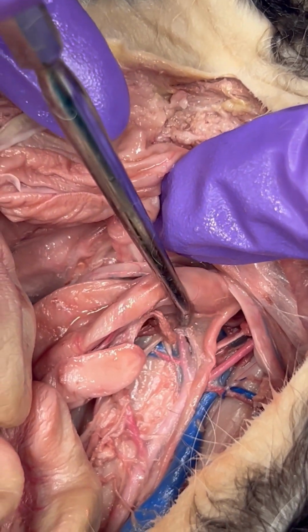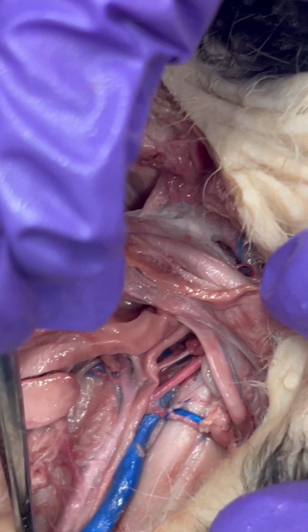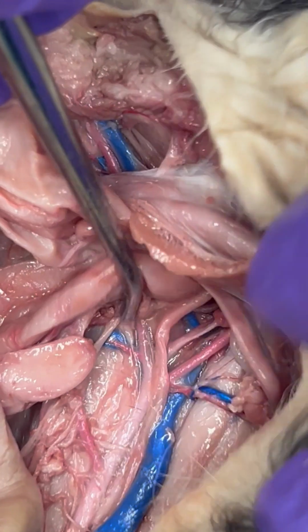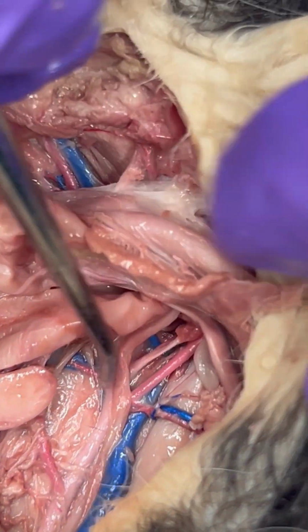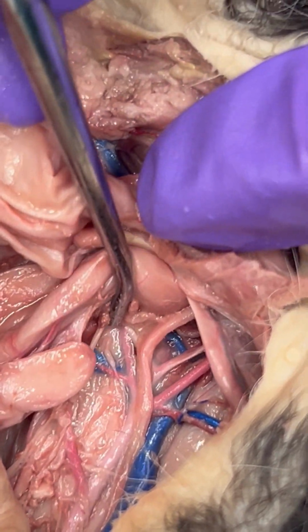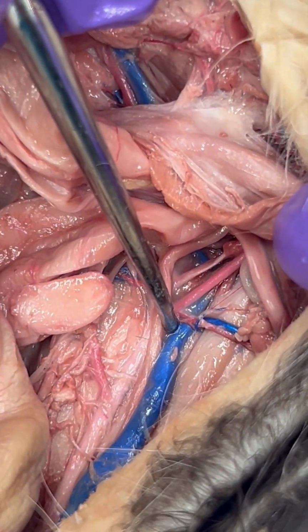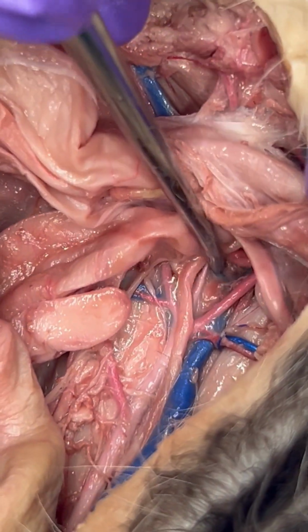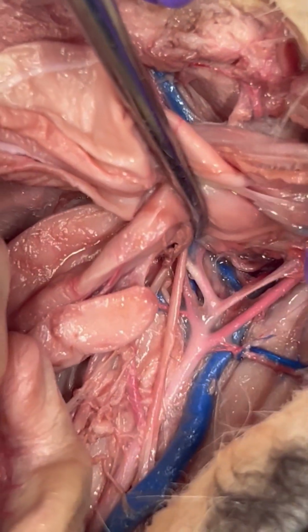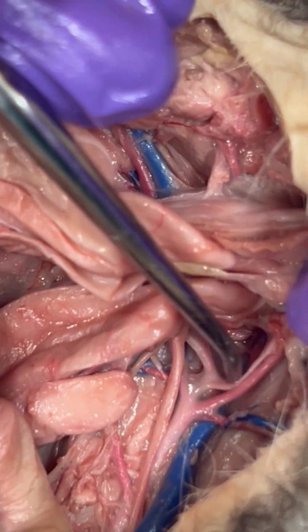And this is going to be called the external iliac artery. So once we've reached the end of the cat more or less, we just have the legs, it's going to break up into the external iliac artery. And then coming off of the post-cava in that similar location, we have the common iliac vein. And the arteries are taking over here, but you can see it splits off into 2.